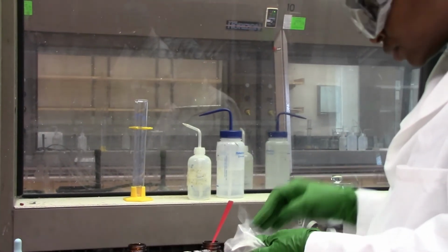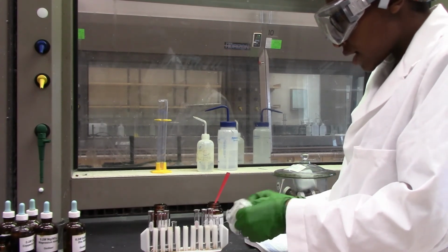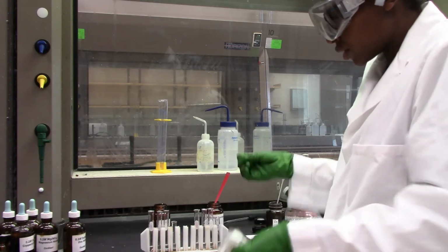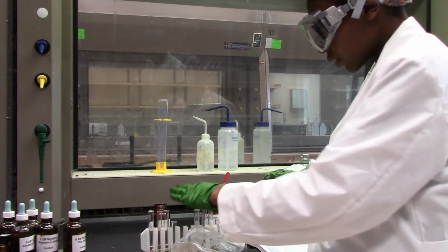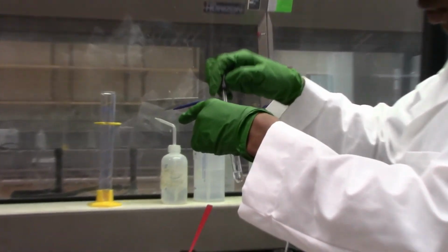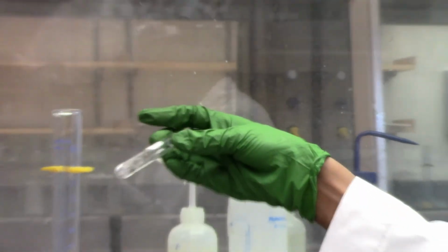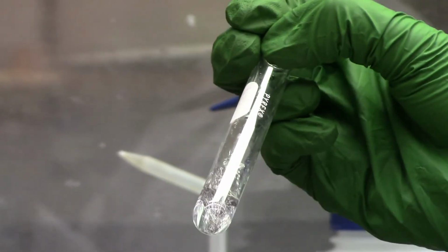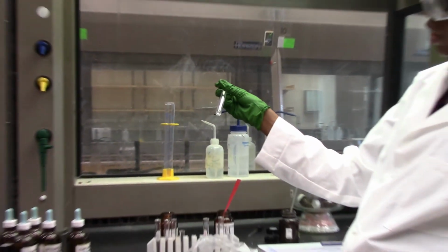Going with iron. Do you think iron is more reactive than zinc? Will it displace zinc in zinc nitrate solution? Let's find out. So, drop iron inside zinc nitrate. The initial color was gray, no bubbles forming, no color change to either iron metal or the solution, which was colorless, and it's still, so no reaction.